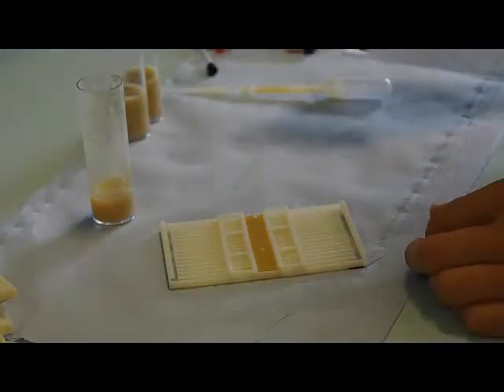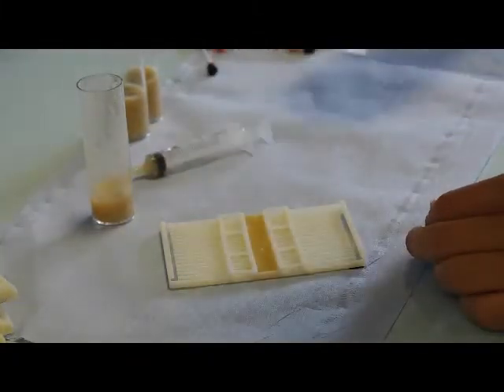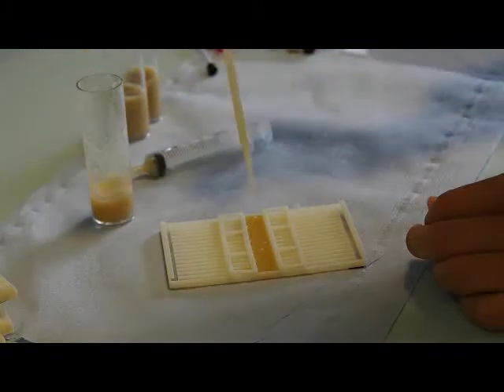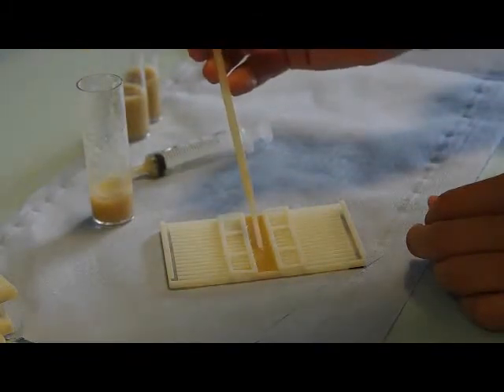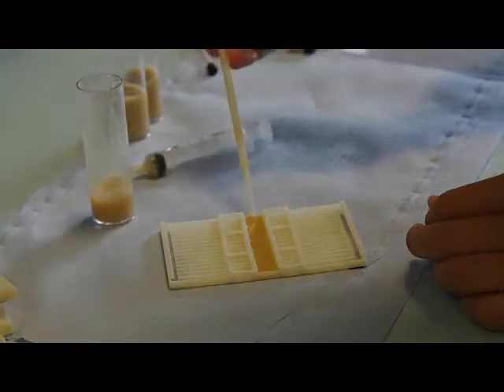If some air bubbles do form, you can suck them out using a Pasteur pipette. Now let everything dry for about 10 minutes.